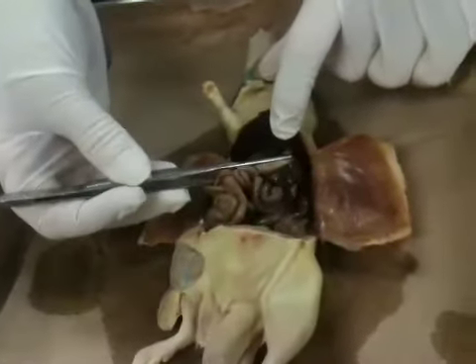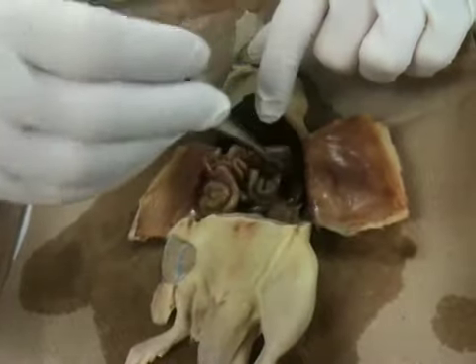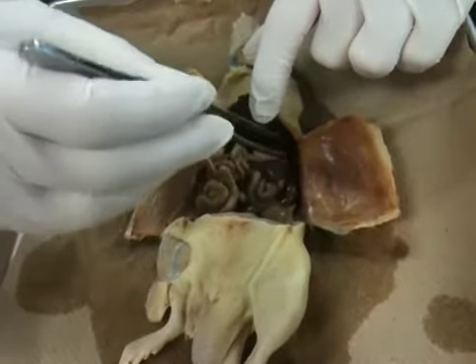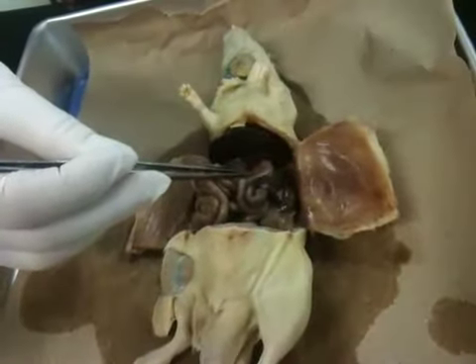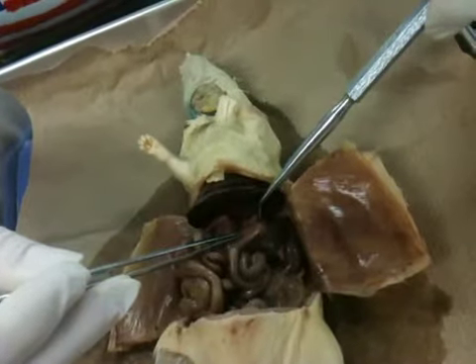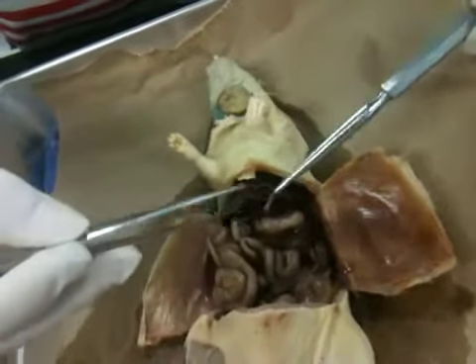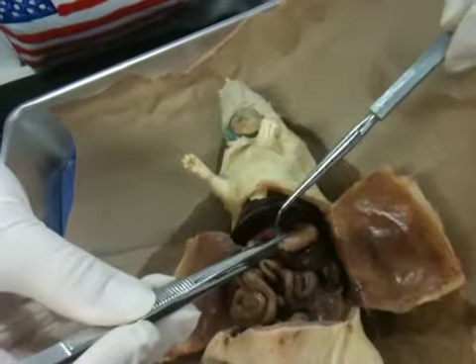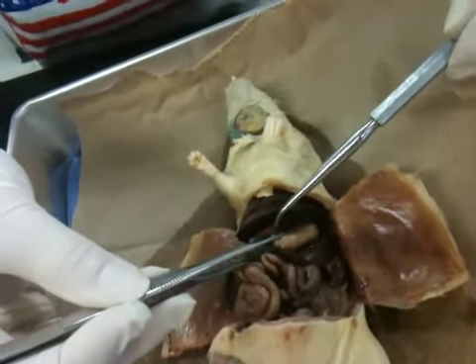So here's the stomach. The spleen is this moon shape, this crescent moon shape piece right here. That's the spleen. So the stomach then has a little knob up here. That is the cardia region of the stomach. The main portion of the stomach is the fundus, and the portion over here that will lead to the pyloric sphincter is the pyloric region of the stomach. You can no longer say stomach, you must say regions.